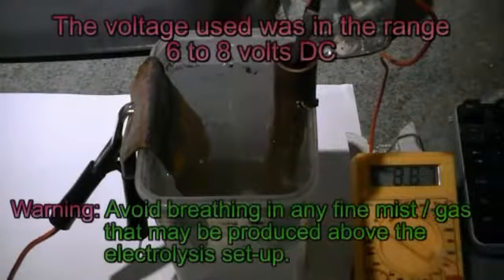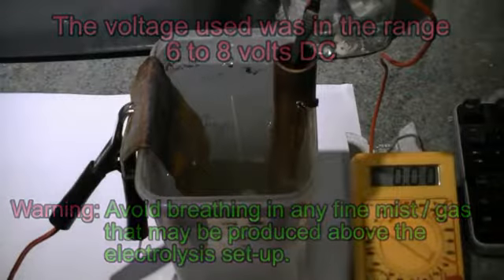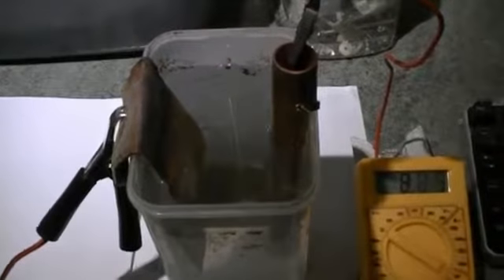We have a multimeter to measure current. And with our power supply turned on, we've got roughly around 8.5 amps going through. And immediately at our copper cathode, we can see a lot of gas being produced. This is of course hydrogen. And at our copper anode, we're not getting much gas produced at all.